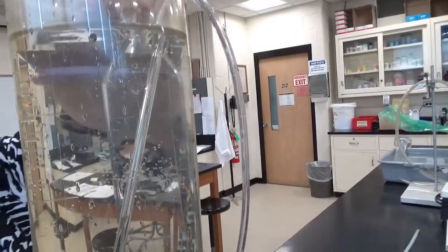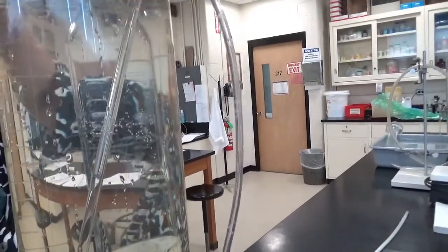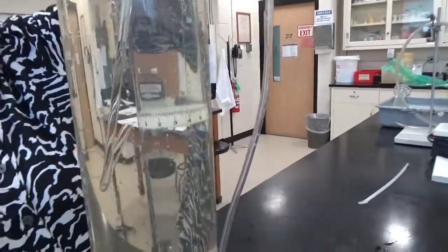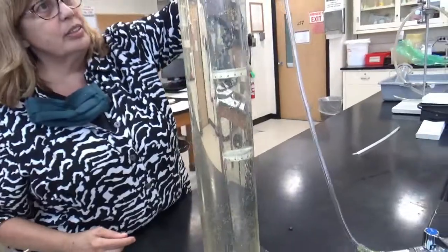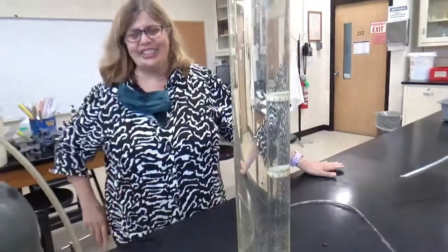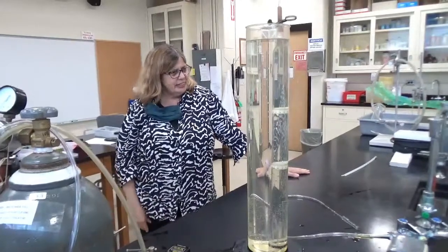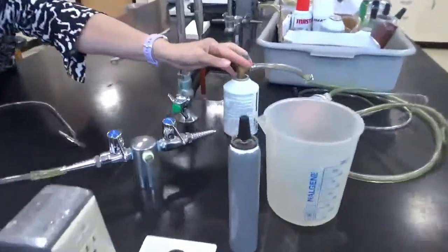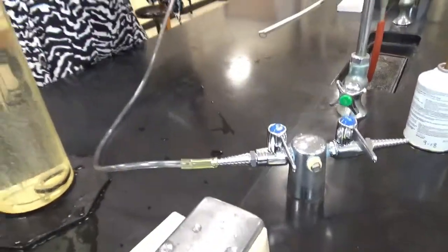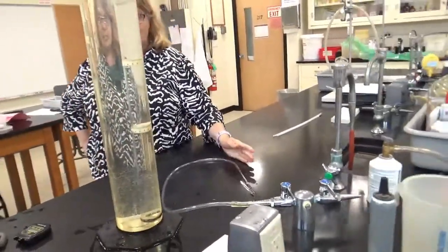So basically, at this point, there's no air, well, there's a little bit on the top, but it doesn't really matter. So I've got this tube completely filled with water. Now what I'm going to do is use this funny hook thing. I have lots of canisters filled with different gases. This one is filled with CO2. That one over there is another gas. And then I'm going to use air. And I'm also going to use what is mostly methane, but is actually natural gas. And we'll have to give you the molar masses of those.